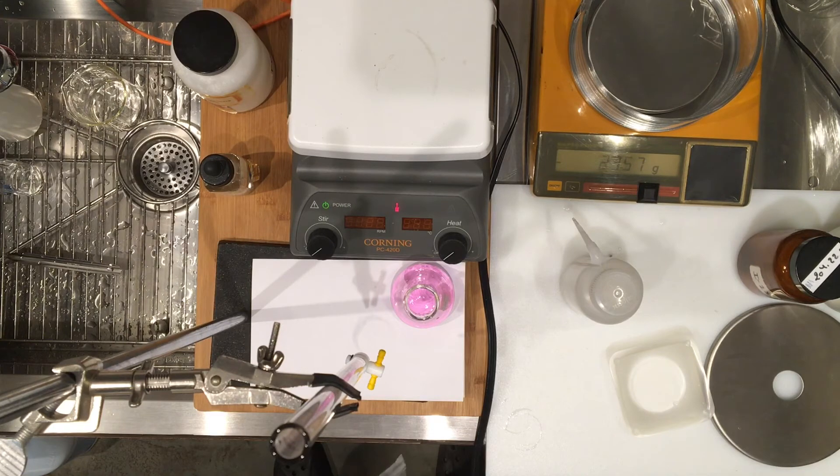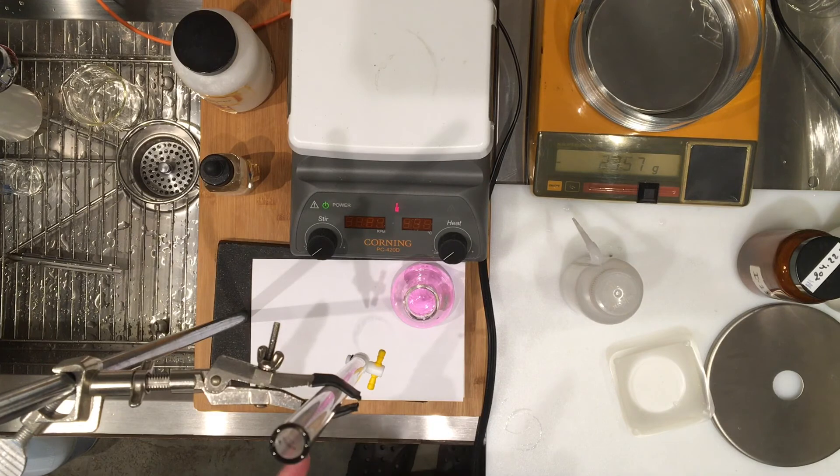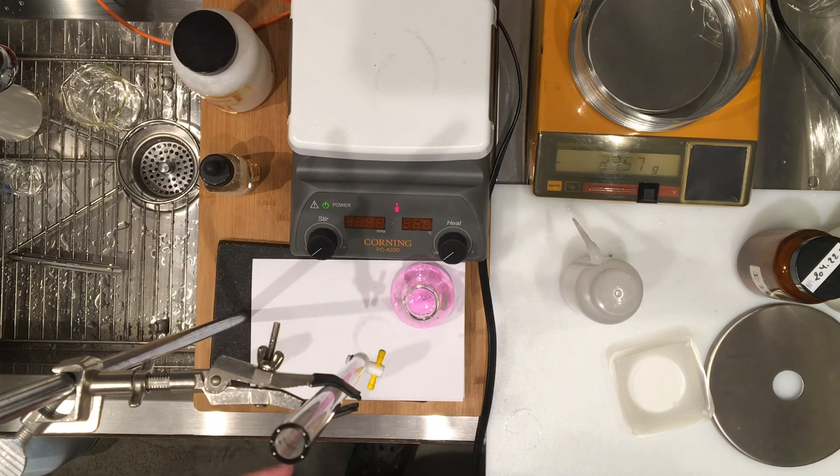You have to set up your calculation using the chemical reaction and I'm going to let you go ahead and do that and calculate the molarity. But let's do this two other times. So you can go ahead and calculate the molarity of sodium hydroxide now with this one trial, and then I'm going to do this two more times and then give you the values.